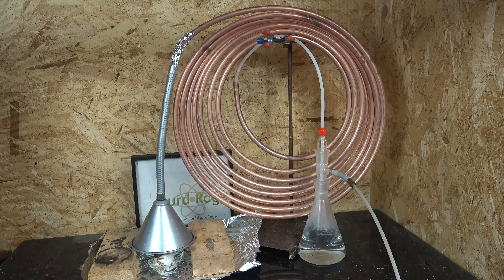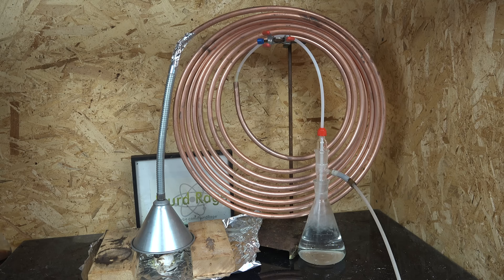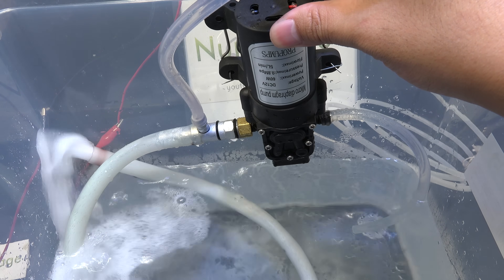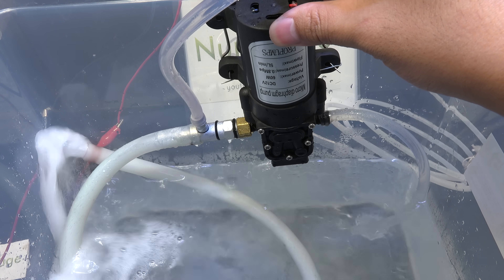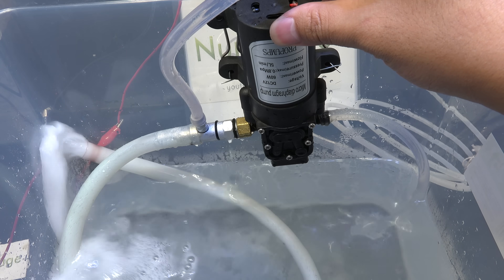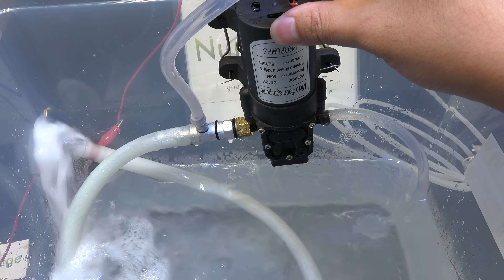It's then connected using easier-to-bend plastic tubing to the reaction flask where we have whatever chemicals we want to react with. The gas won't push itself into the apparatus, so instead we pull it using a vacuum by connecting the reaction flask to a vacuum adapter. As we pull a vacuum through the adapter, gas is pulled down through the top of the adapter and into our reaction through that inner tube — the same tube that connects to our cooling apparatus. This allows us to use sulfur dioxide without having to build a sealed combustion chamber. We've already shown how to make a fairly cheap aspirator vacuum pump in a previous video for use with this setup. If your reaction is safe toward the metals of the aspirator pump, you can also use the aspirator pump itself as a reaction vessel and simply add your chemicals to the pump water. But I personally don't recommend this, as contaminating your aspirator pump apparatus with chemicals is messy and more headache than it's worth during cleanup.